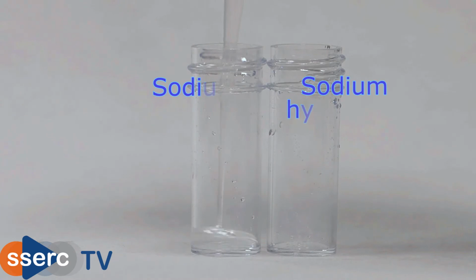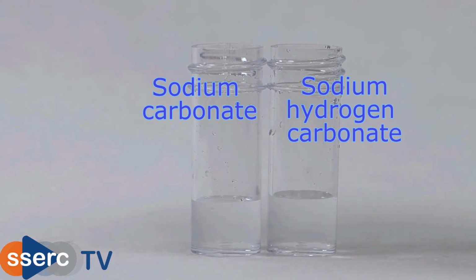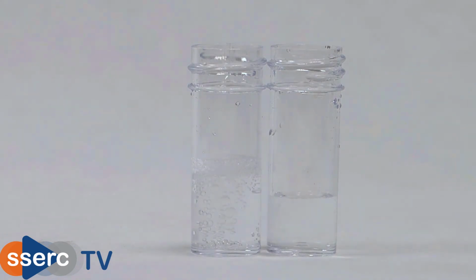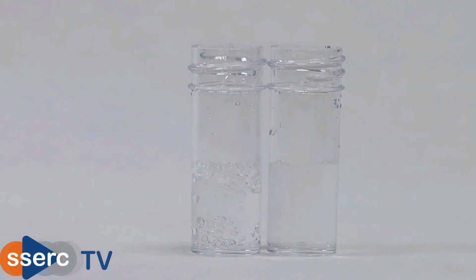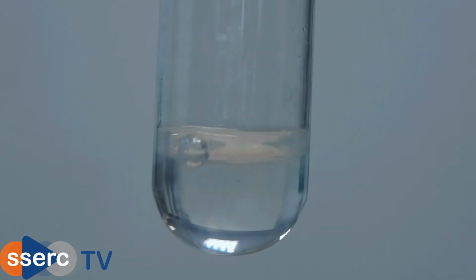First of all, carbonates. Take your unknown solution and add some dilute acid to it. If it bubbles, it will probably be a carbonate. Note though that dilute solutions like the one on the right here will not bubble very much. If it is a carbonate, then the gas given off is carbon dioxide, and you test this by bubbling a sample through lime water to see if it goes cloudy.